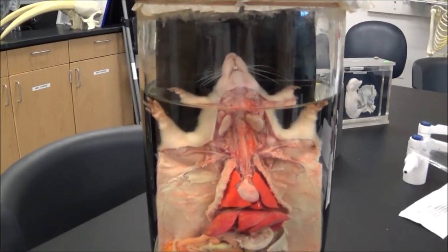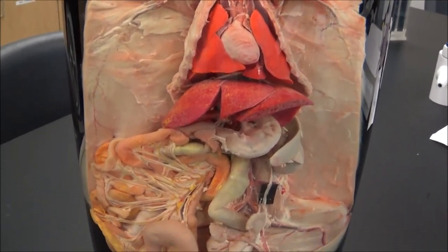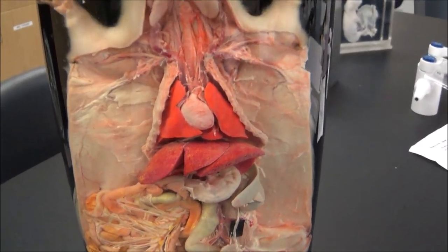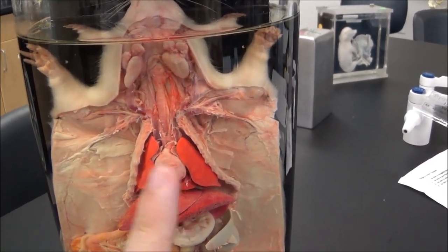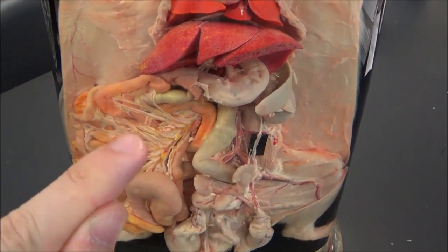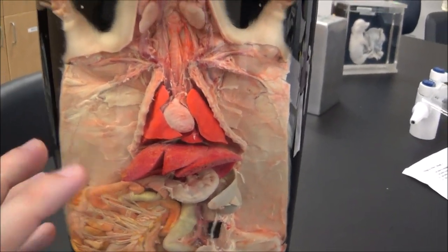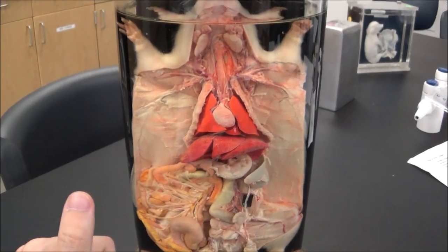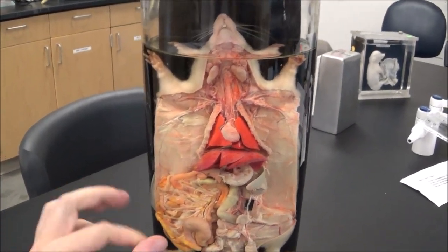I'm going to show you the internal anatomy of a rat. You'll note that they have all the same basic anatomical structures as you would see in a human or in the dissection pig. You can see lungs, the heart right there in the middle, a multi-lobed liver, stomach, and intestinal tract. All of this is very akin to what you would see in a dissected pig or in the human body — just another clear example of why rats have been very popular laboratory animals.